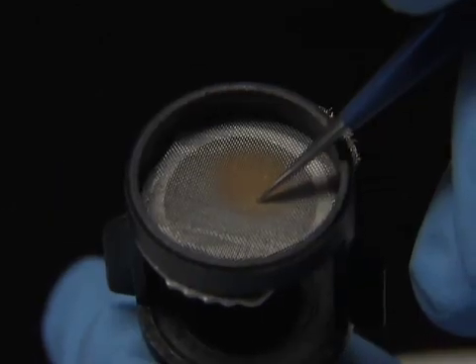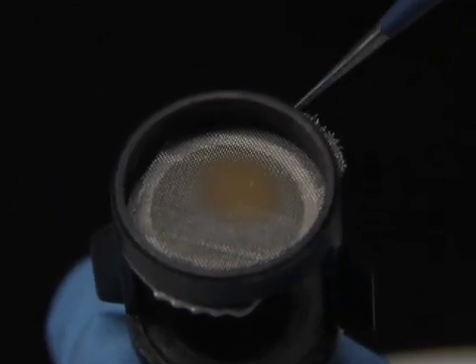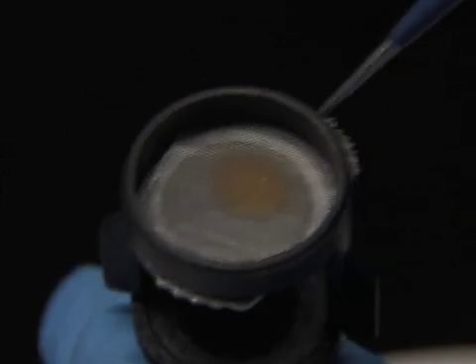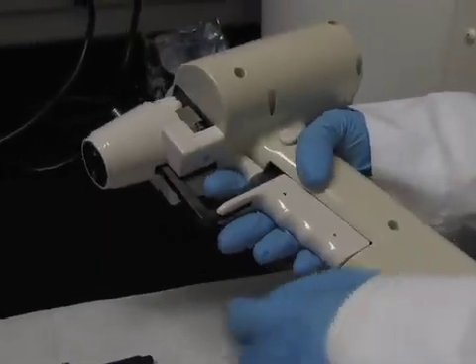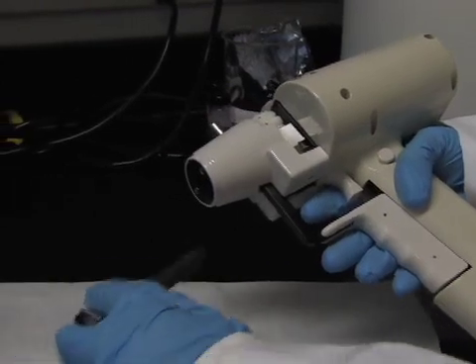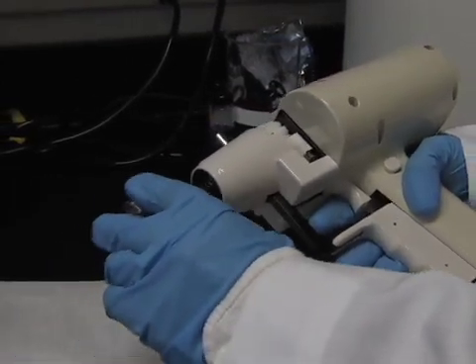Now the barrel liner needs to be attached to the gun. First make sure the O-ring is in the barrel liner and that the diffuser screen is secure. The screen acts to spread the pressure from the barrel and leads to the spray of the gold for a more even dispersion of gold in the well. Screw the barrel liner all the way into the gene gun.